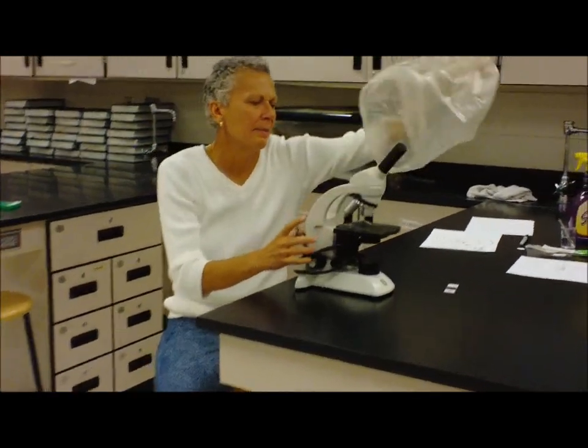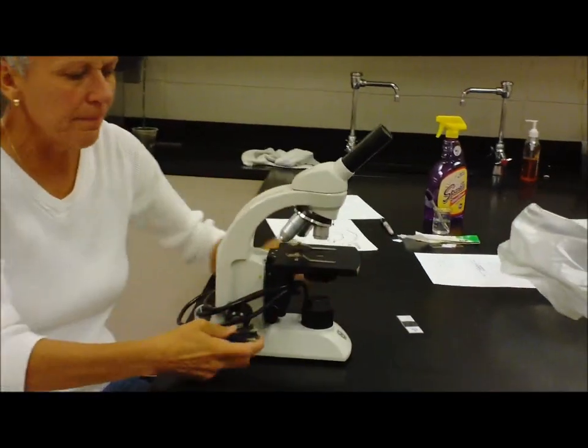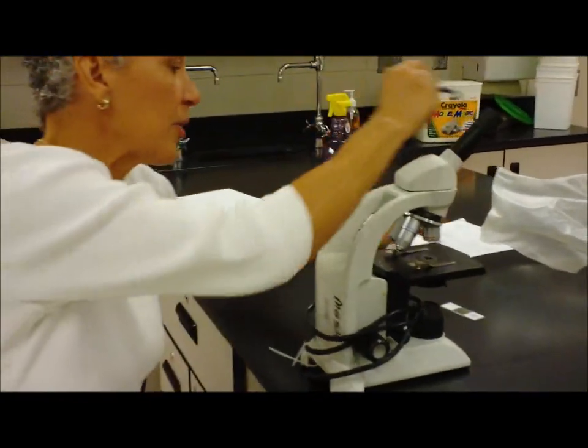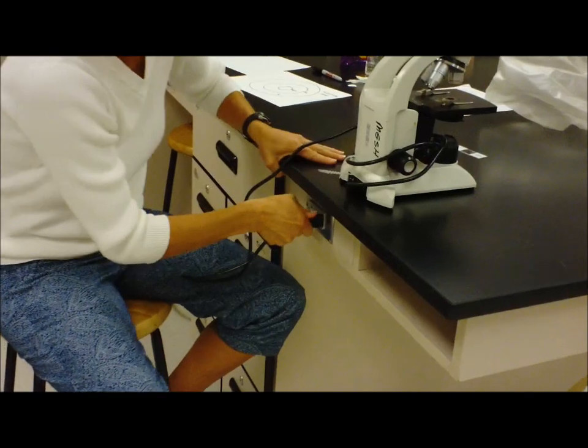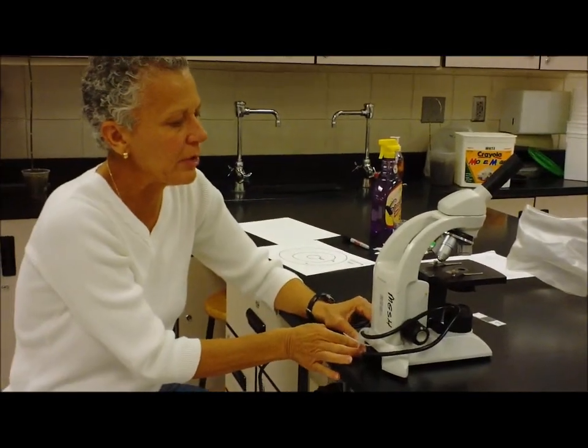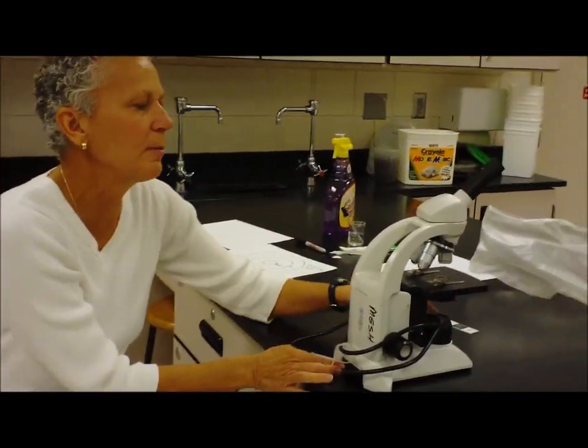If you come around to this side, and I'm ready to plug it in, I'm going to unwrap just as much cord as I need to get to the outlet. Once I've plugged it in, the on-off switch is here in the back, and I should see some light down here.